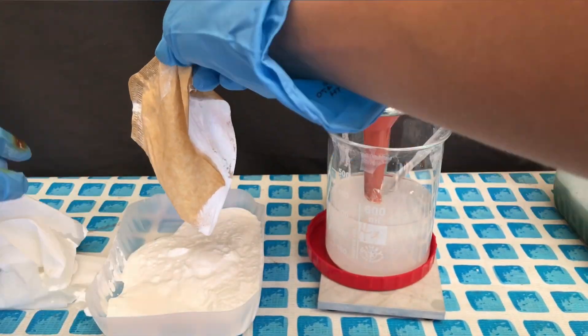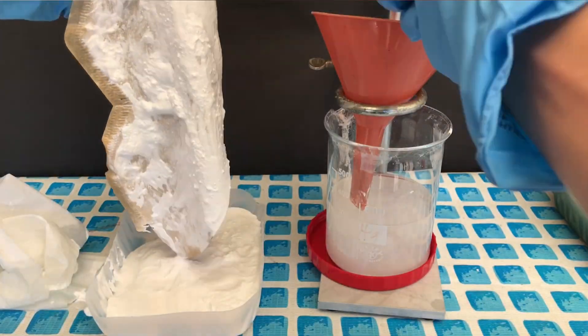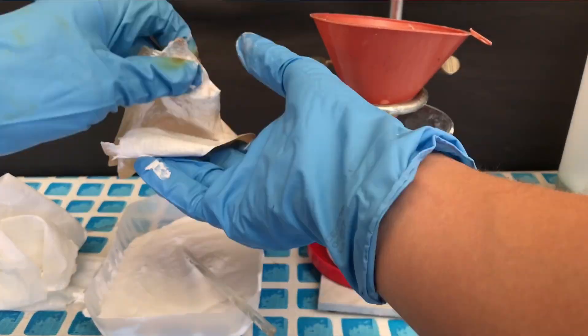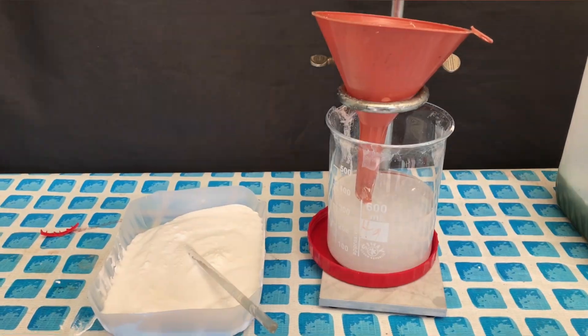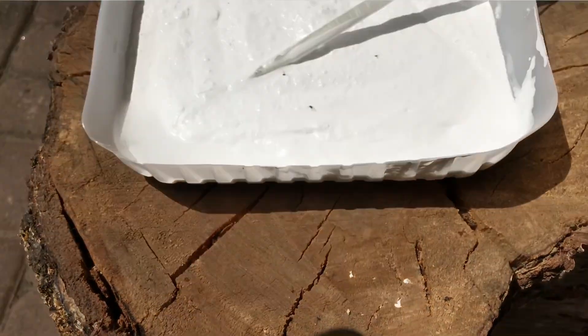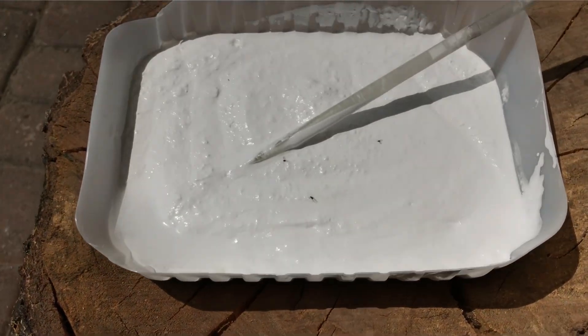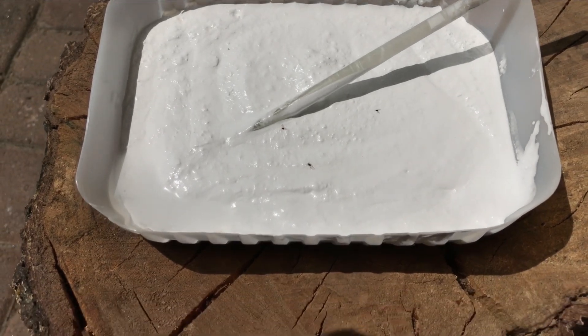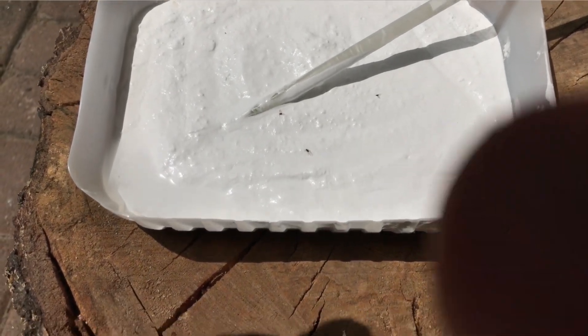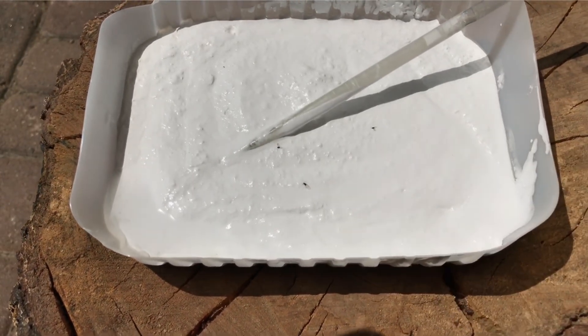The lead chloride was transferred to a drying dish which turned out to be a huge mess but I didn't want to dry it in my vacuum desiccator. It still contains hydrochloric acid which would destroy the metal fittings in my vacuum desiccator and therefore we dried it in the sun. And yes these are flies but it should be just minor contamination.